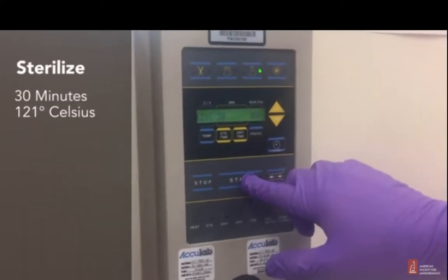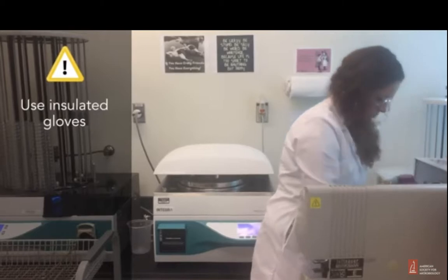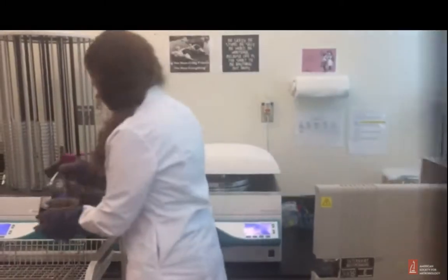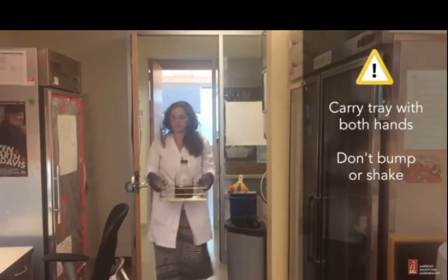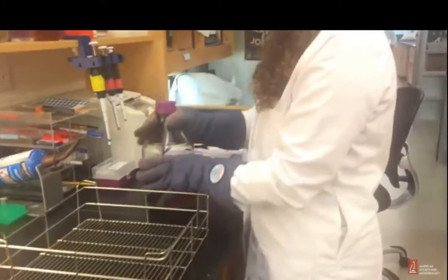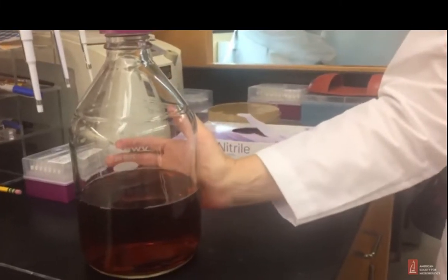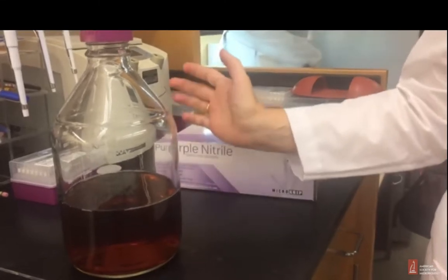Okay. Put the bottle into an autoclave and sterilize it. I don't have an autoclave. 30 minutes at 121 degrees Celsius. It will come out hot and molten. Be sure to wear gloves and put the molten agar into a tray so that you can move it to the lab. Wow. And put it in a safe place where no one will disturb it. Wait for about 30 minutes to an hour for it to cool down. I like the way she's handling this stuff. When it's uncomfortable to touch, but not scalding hot.